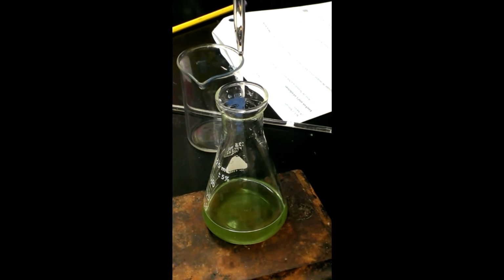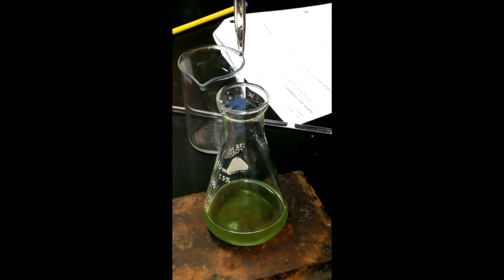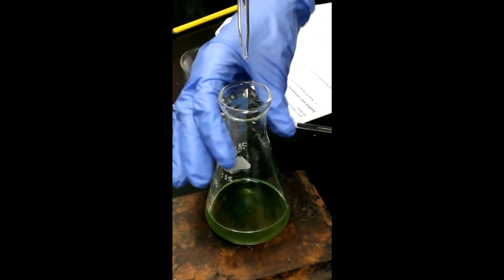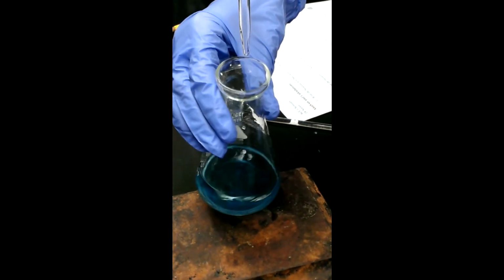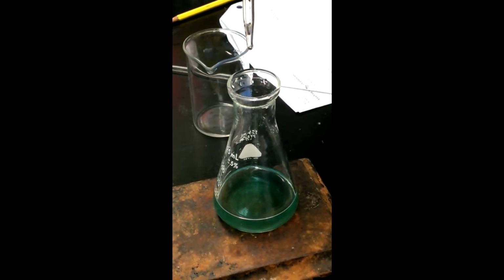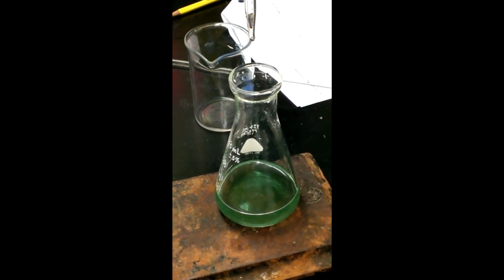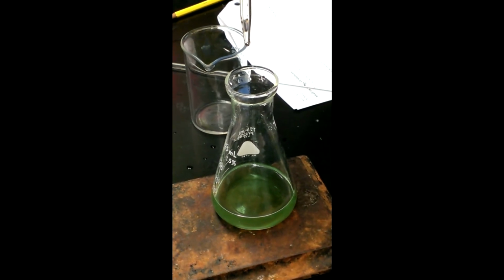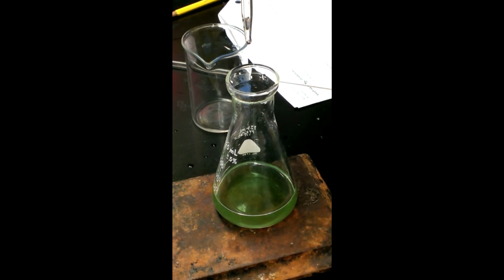In the last section, we show one that is fairly accurate. We get to the green color. The green color is very good for weak acid. One drop's added, it goes to the blue, fades just a little bit more. The student is recording their data, and add just another drop, and this should be reaching the endpoint.